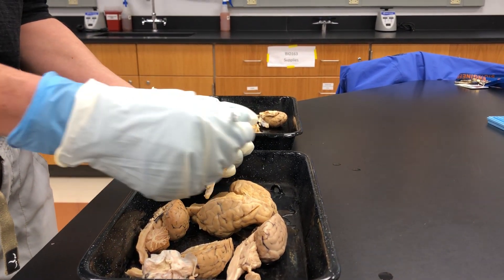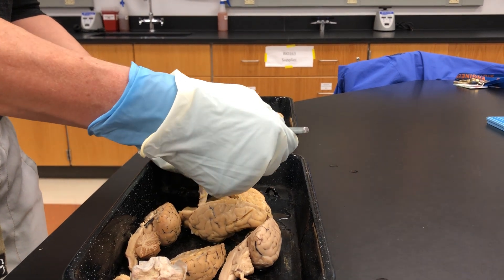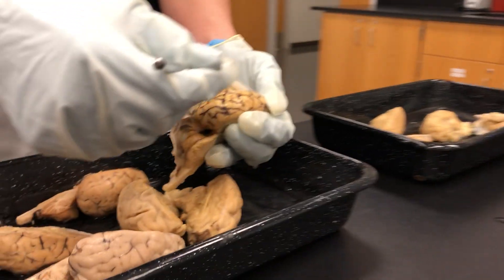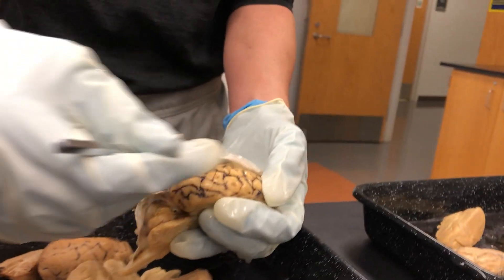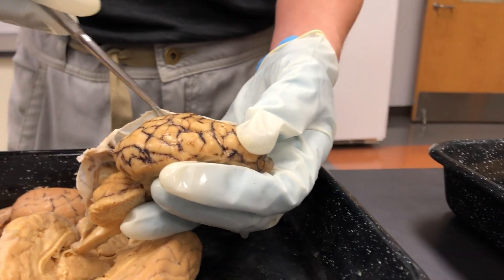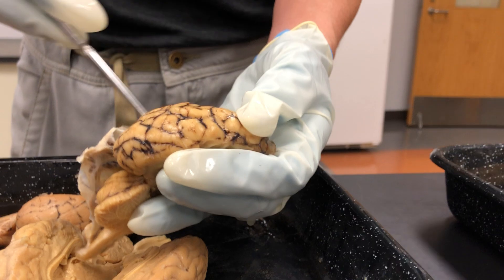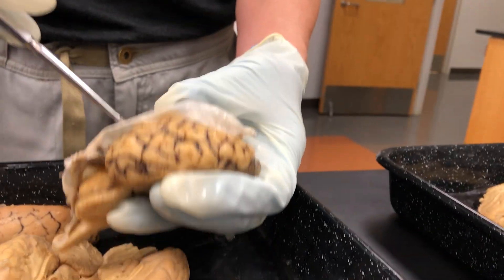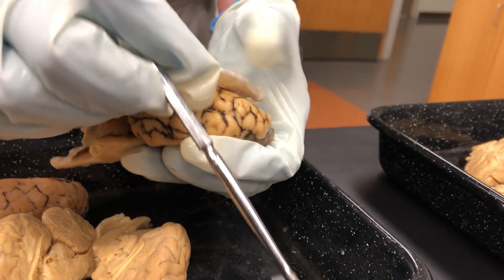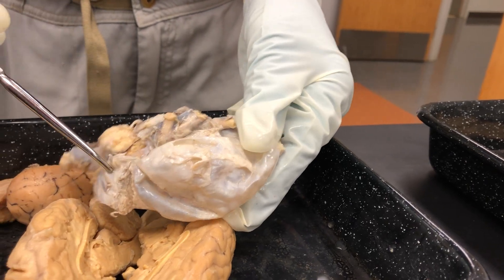The first item is the dura mater. The dura mater is this hard outer covering — it's the outer layer of the cranial meninges. If you look at it, it looks a little bit like one of those semi-transparent plastic garbage bags, and it covers the entire brain and the underside as well.